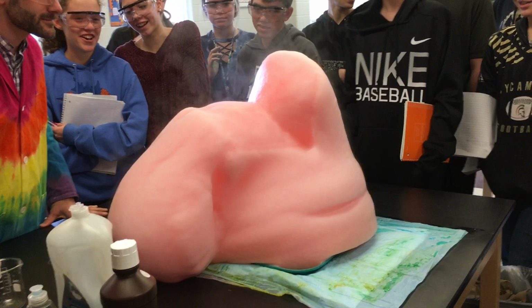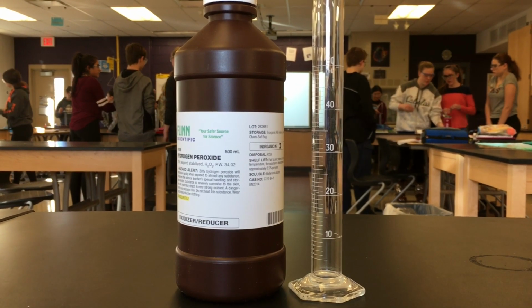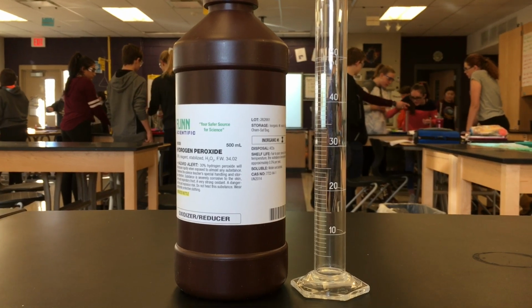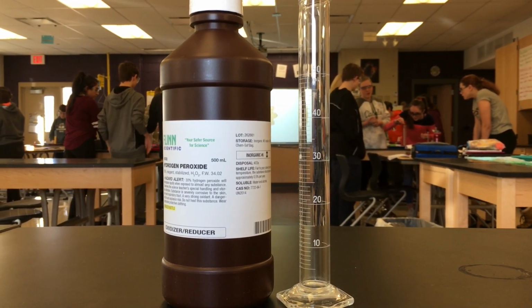Okay, so that was pretty cool. But what's going on here? This is an experiment called elephant toothpaste, and it takes a couple things to know. First, you need hydrogen peroxide. Hydrogen peroxide is what you use at home to clean out cuts. The difference is this is a little more highly potent. It's 30% as opposed to the 3% that you might get at home.